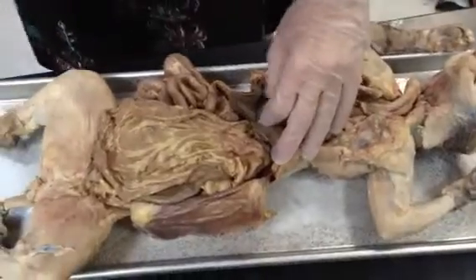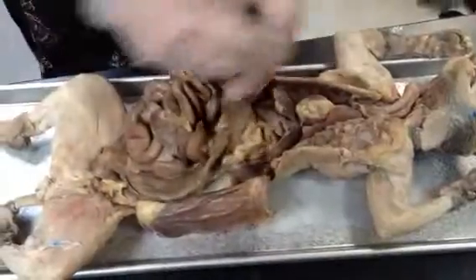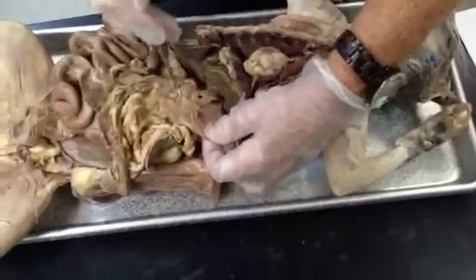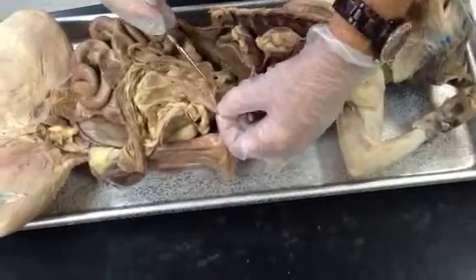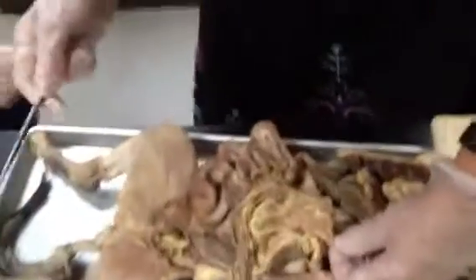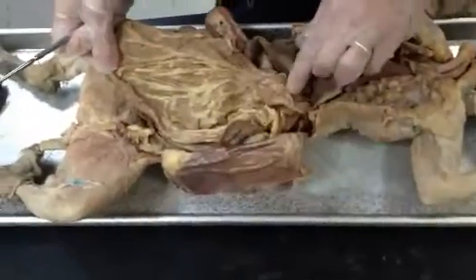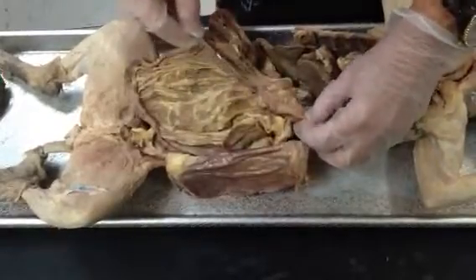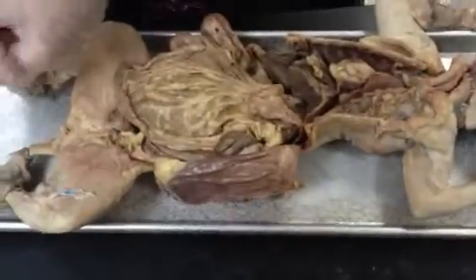Okay. All right, number 11 is the stomach, so we got to raise the omentum. Where is our stomach? Okay, here's our omentum. Here's our stomach, this J-shaped organ here. You got good greater omentum, and you got a little bit of the lesser omentum here. I won't ask the lesser omentum, but I will the greater omentum. I think I told y'all. It just says omentum. Yeah, but I think I told y'all you need to tell me the greater omentum. Because we did identify the lesser omentum in class and everything. So stomach, greater omentum coming from the greater curvature, lesser omentum coming from the lesser curvature and going up to the liver. All right. Then the pancreas.